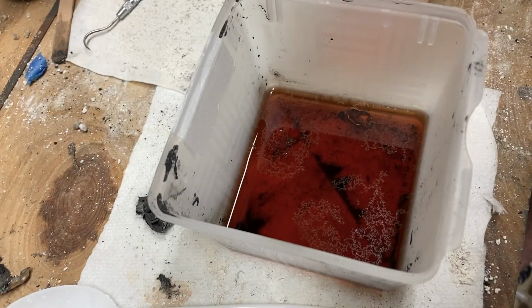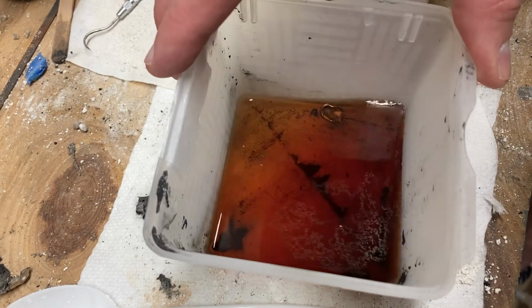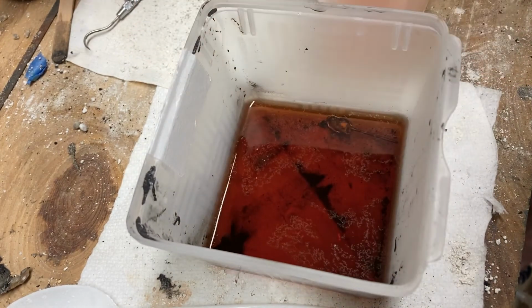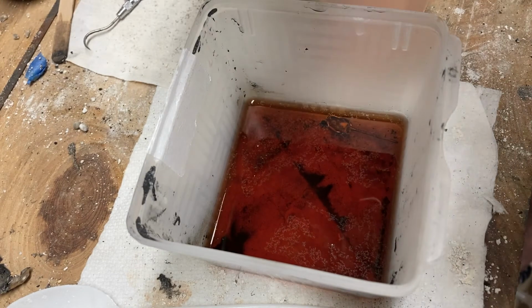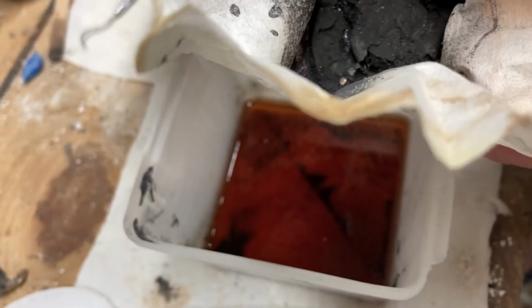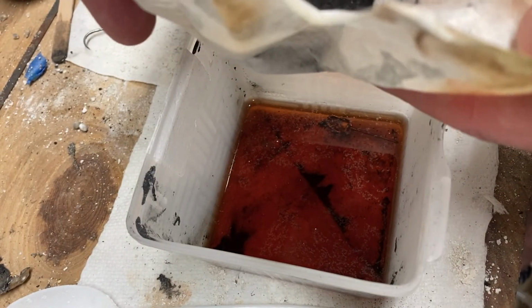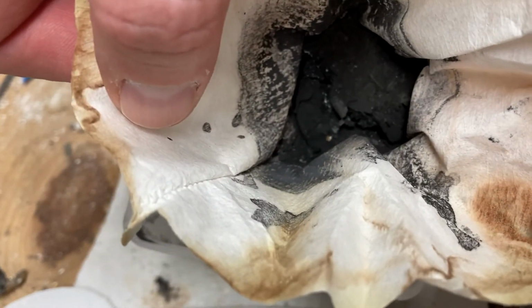Well, this right here was a fail. You can see that we ended up with some brownish water here, and I did get what appears to be most of the manganese dioxide and probably still a little bit of the zinc oxide based on the white stuff in there.